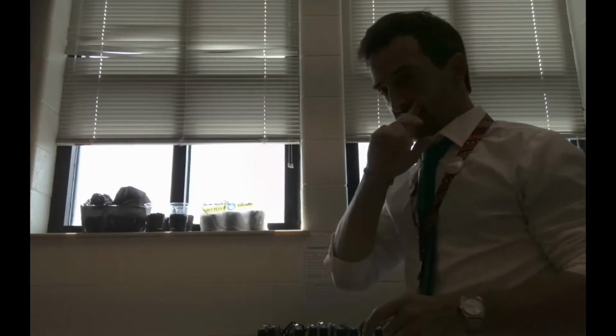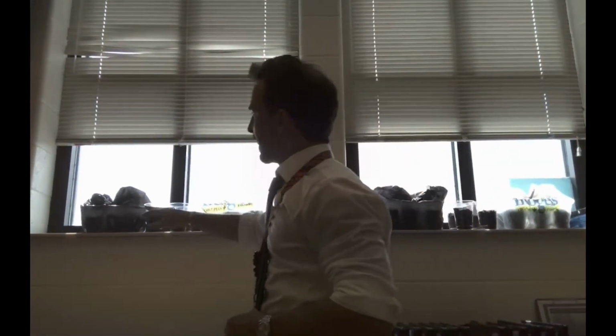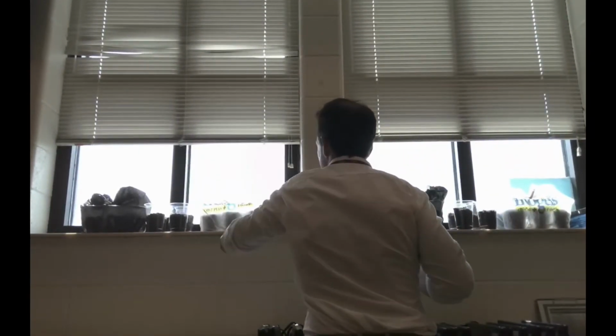And third, our group in the middle here are our control group. This is the group that is going to be grown under normal conditions. They're getting the normal amount of sunlight, whereas the white bags are getting a little less sunlight, and the black bags are getting even less sunlight. So we will take the one we just did, and we will add it to the party.